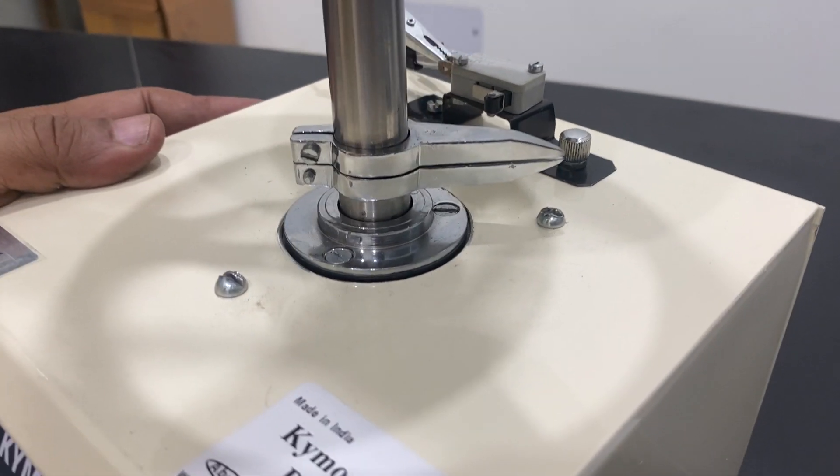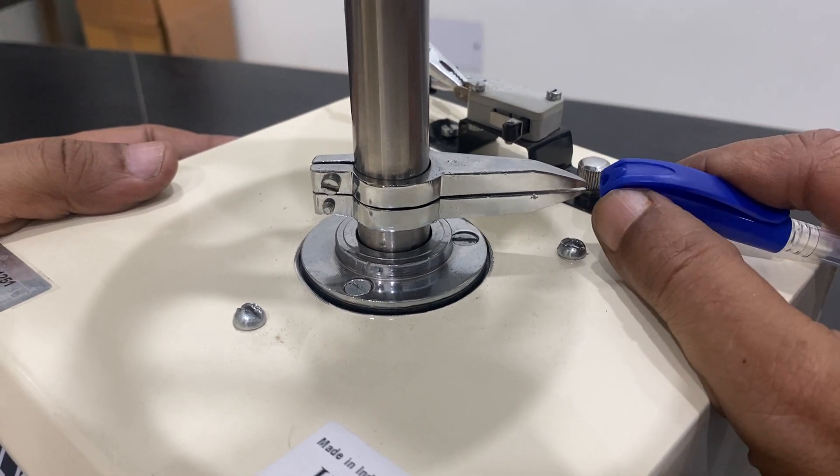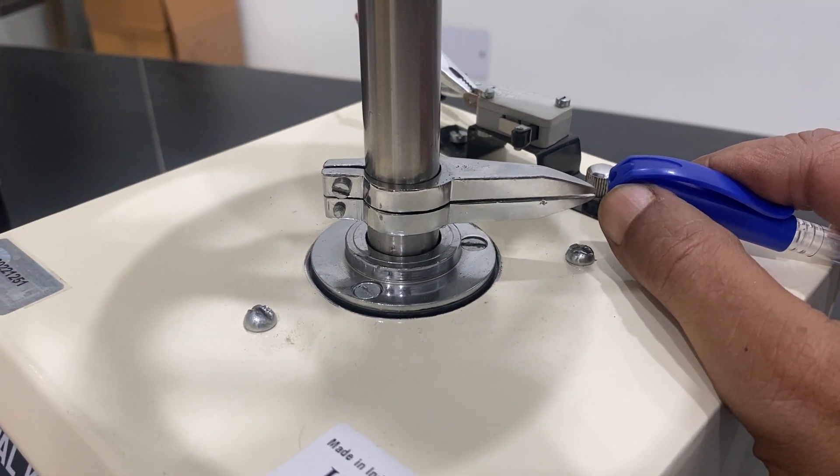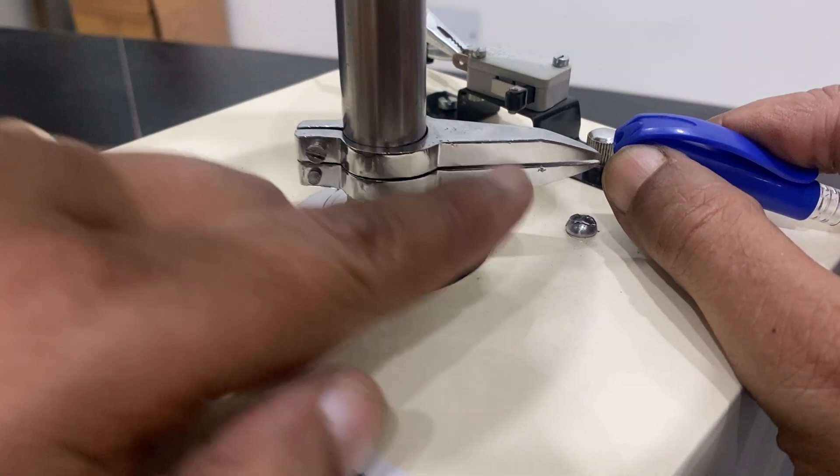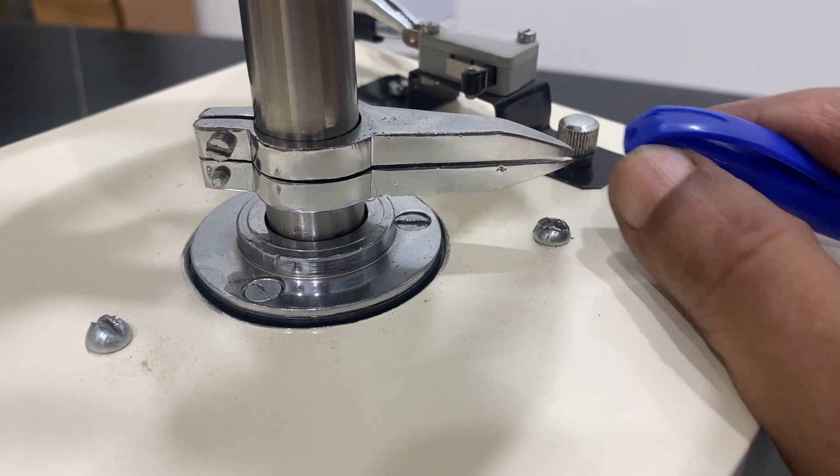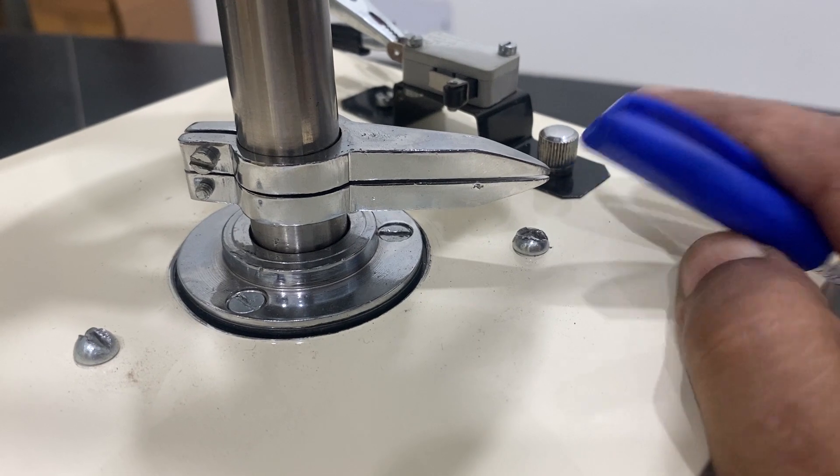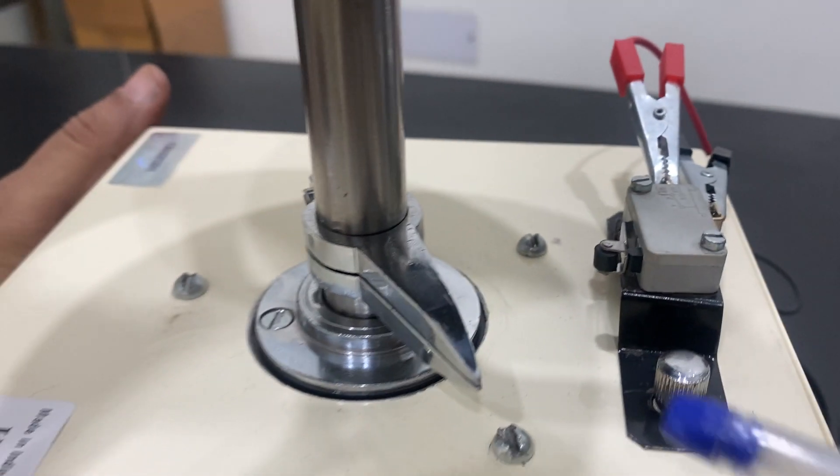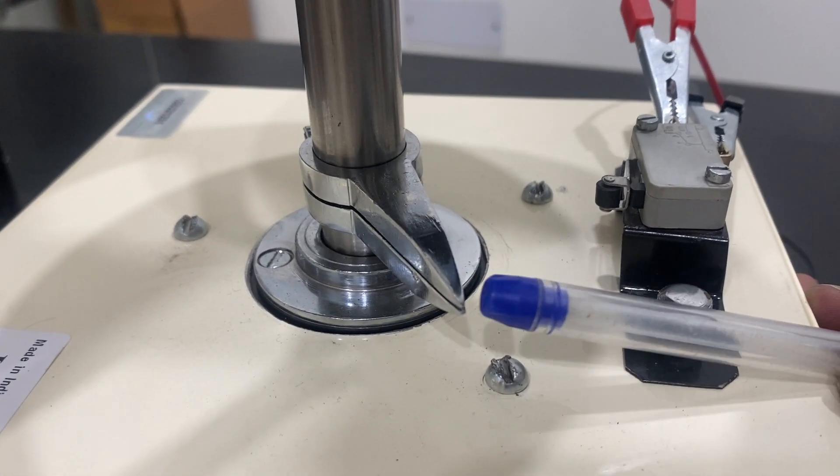I can stop it again, make it slower to view this. You have to put something here, start. See, the sound is coming and it is moving. See, this is moving. You can visually see it is moving, just see it is going away from this, moving, moving away.